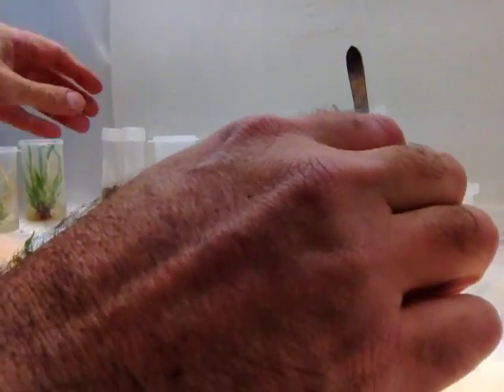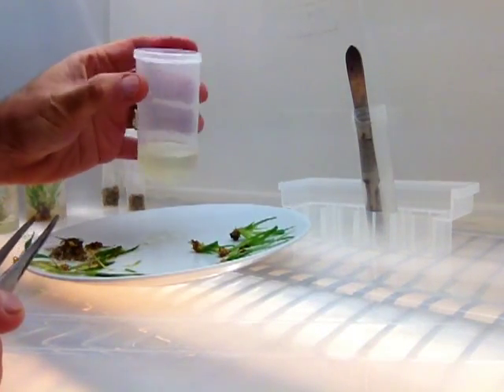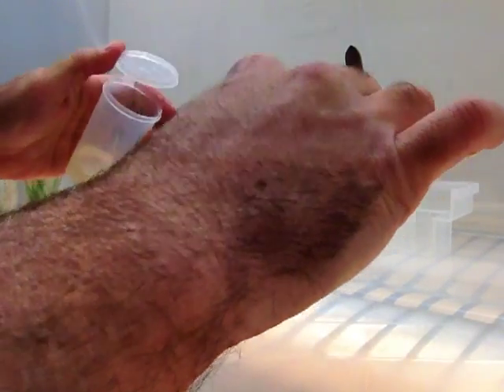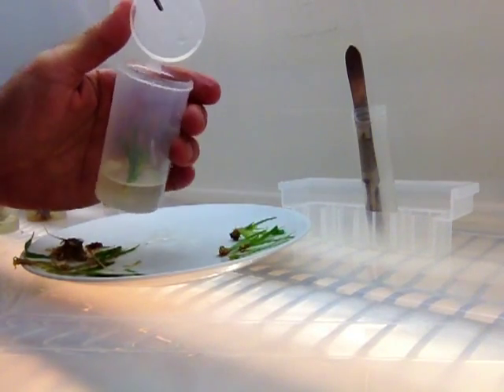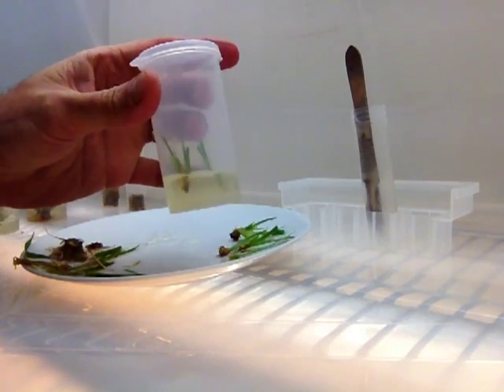Now I'm going to plant these. Here's a clean vessel just made — I save these for up to like a month at a time. Number one goes in, and number two. Snap the lid down. That's why the flip-top vessels are so cool.